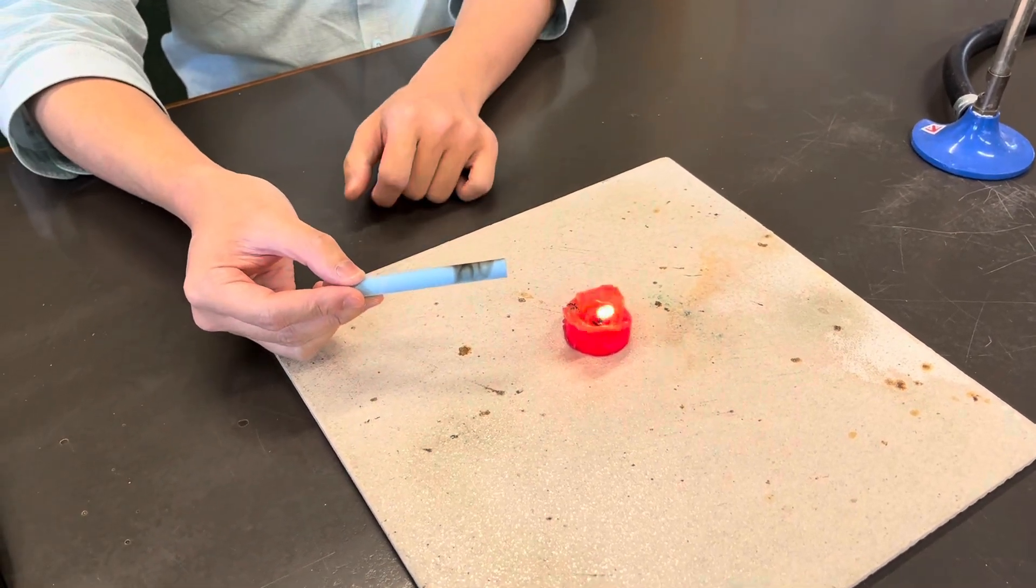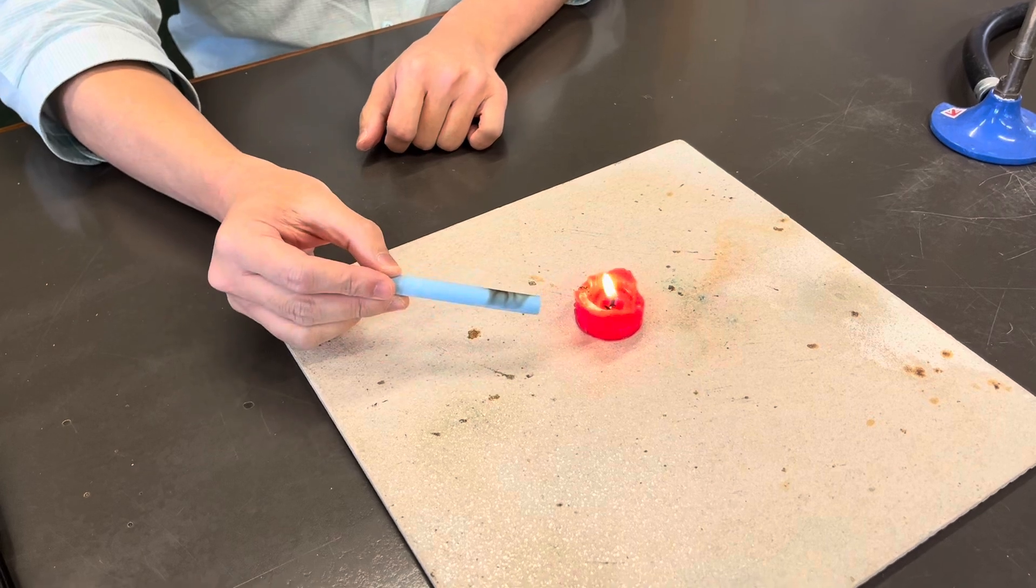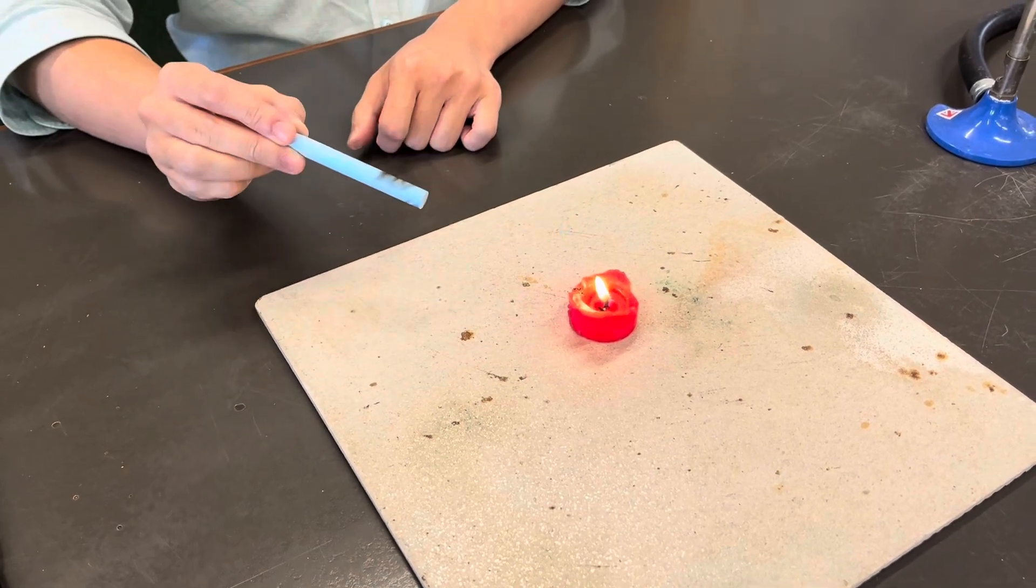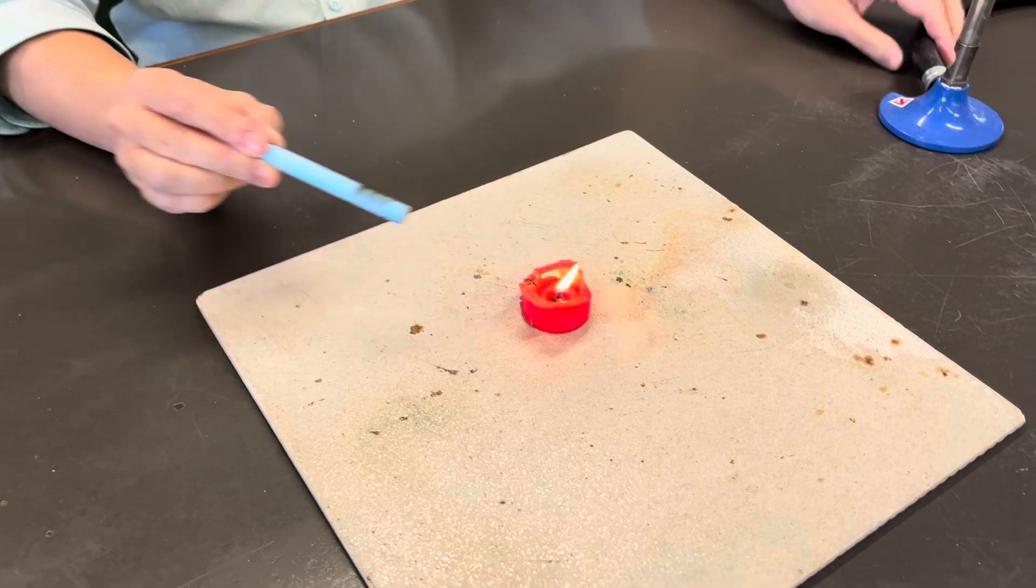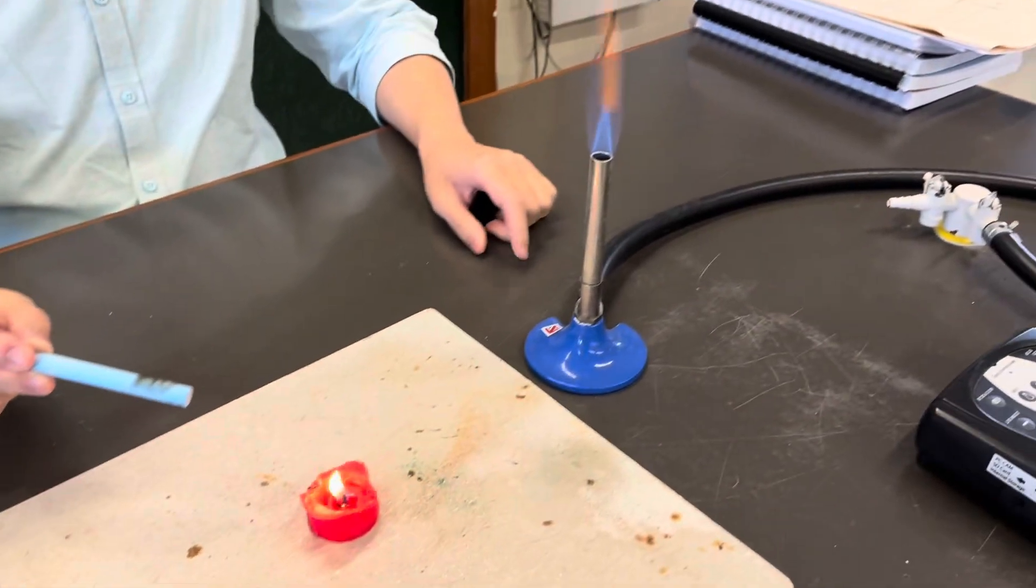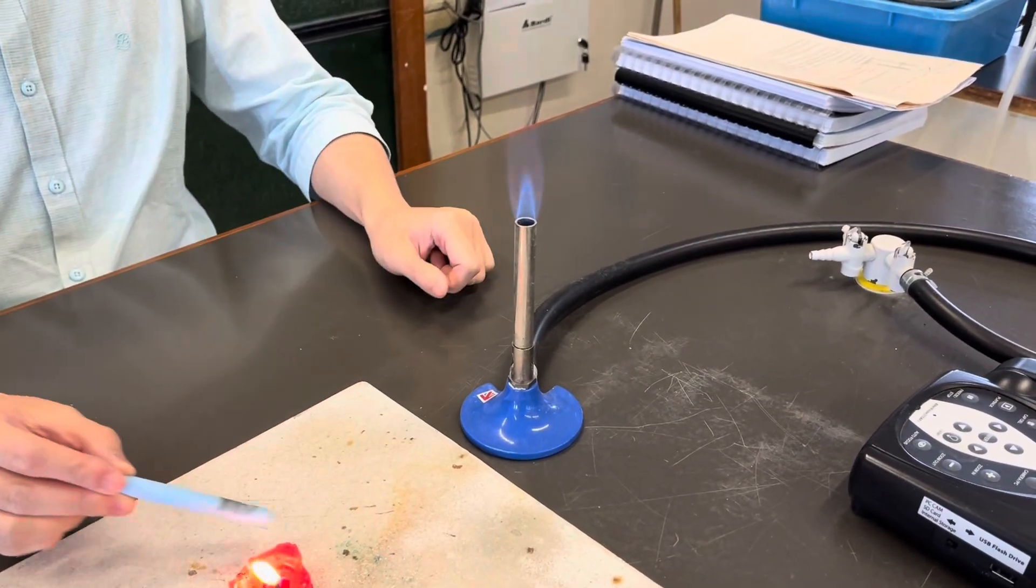Is it from the calcium carbonate or from the candle wax? And look at the flame color also of a candle - it is a yellow flame, and for a Bunsen burner it is actually having a blue flame. What is the difference?